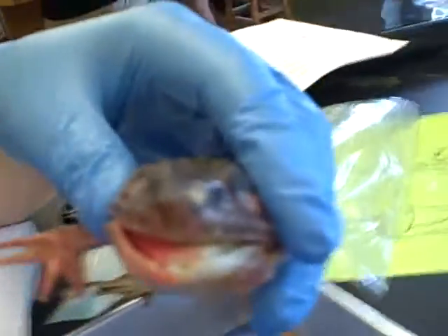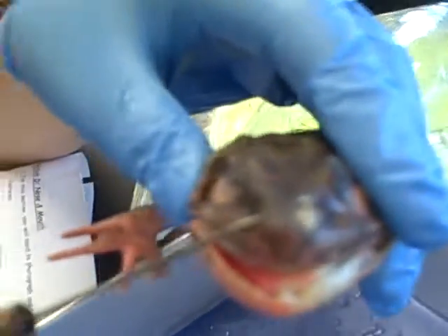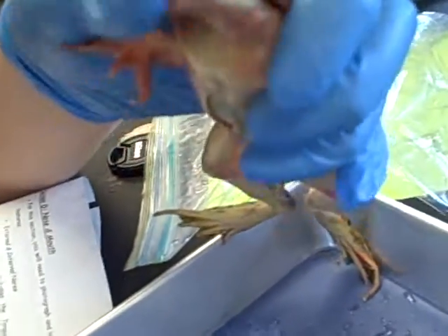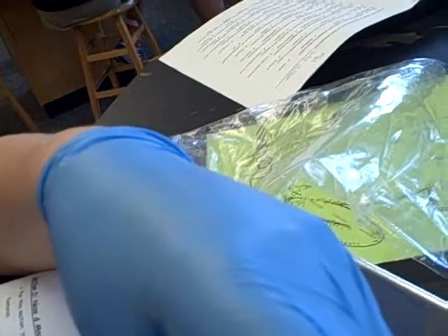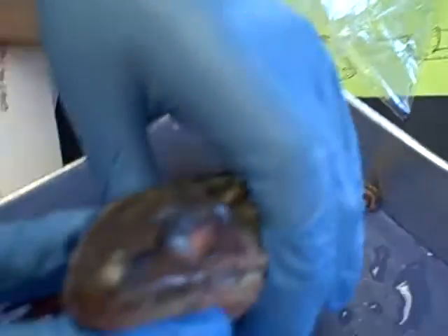Locate the nostrils and external nares at the end of the nose. The more common name for the external nares is the nostrils. For the frog, these connect to the pharynx. Their function is to help it breathe. If the frog swims on top of the water, its nares will slightly stick out of the water, allowing it to breathe while swimming.